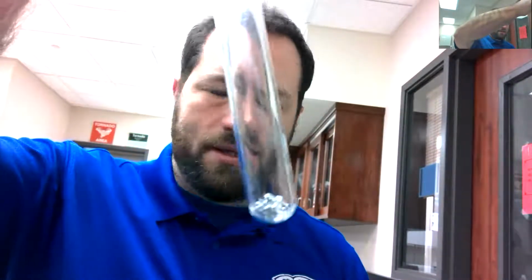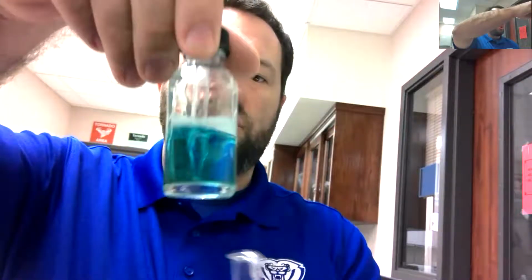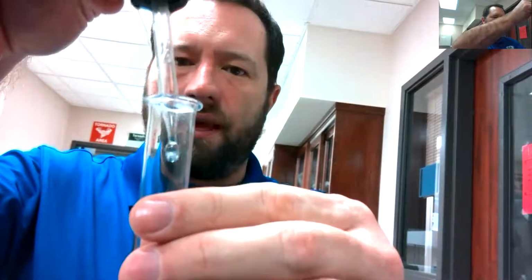There's a test tube. I'm going to put my aluminum foil into the test tube. So there we go. We've got the aluminum foil. You can notice the color on that. Here is my copper 2 sulfate. The direction said 1 milliliter, but for this lab, we're not going to be too particular. Just give that a good squeeze. There we go. And there's that nice, pretty blue color that the copper sulfate has.